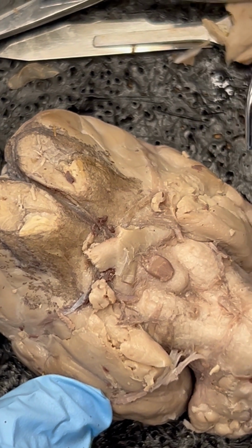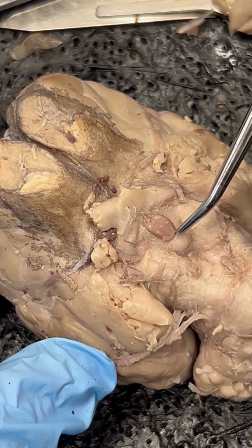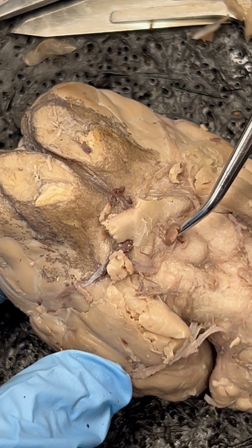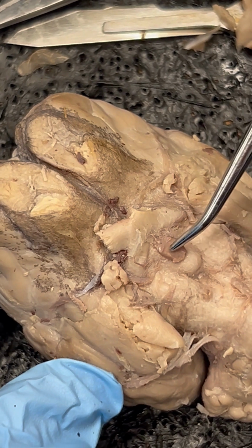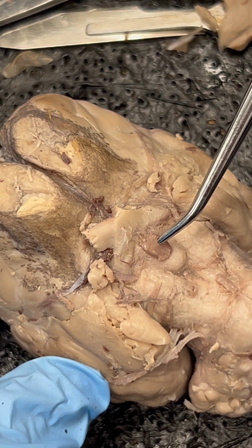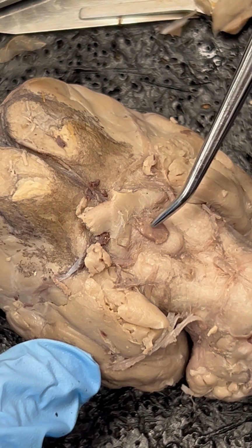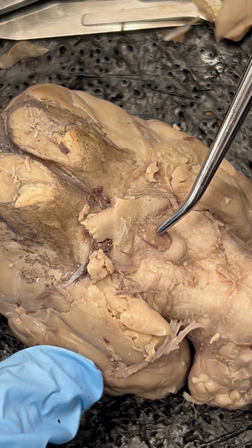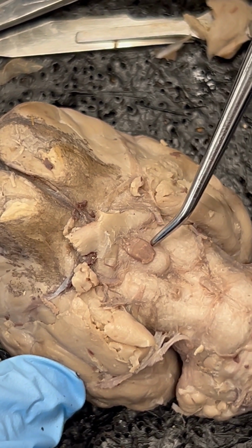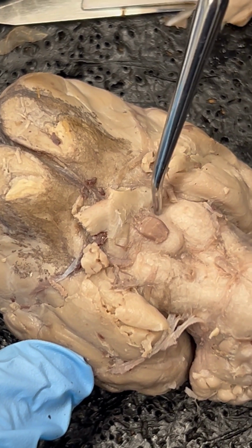Next, we have number 6, the infundibulum. This is the little stalk. It's a remainder of a stalk. I can even lift it up a little bit, but I want to be careful that I don't hurt the specimen. But the infundibulum would have the pituitary gland attached to it, but in this case, the pituitary gland was removed. So we need you to know the infundibulum that leads to the pituitary gland. Number 7, the tuber cinereum is on either side of the infundibulum. So tuber cinereum, tuber cinereum.